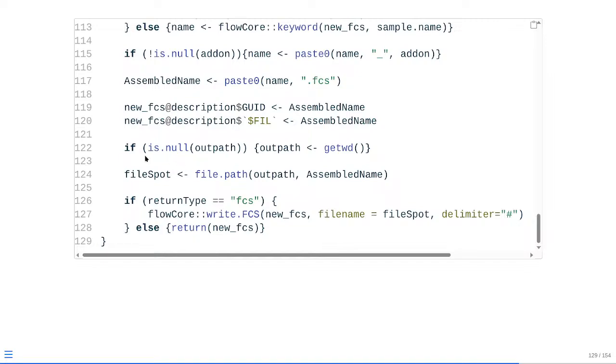However, in a situation where it's left with the default, if the outPath is null, which is going to be evaluated as true, it's just going to go ahead and evaluate this line of code. It's going to go grab what our working directory location is, and it's going to assign that out to outPath. And then at that point, it's going to combine with our existing name into a file path argument to build out where it's being saved to. And then at that point, depending on what our return type was, if our return type is equal to FCS, it will go ahead and write it out as a new FCS file, saving it to that designated location. Otherwise, it's just going to return to us our little flow frame object to our working directory.